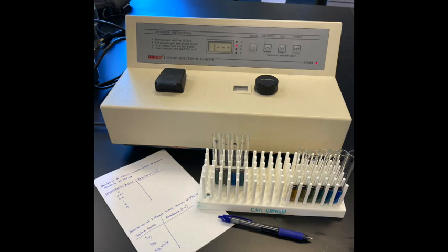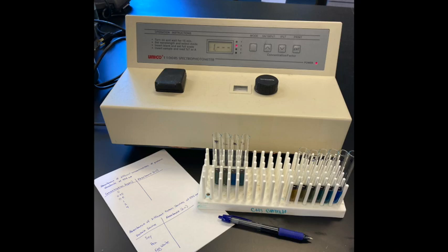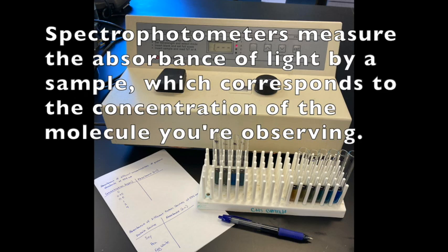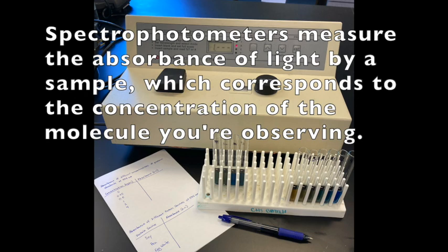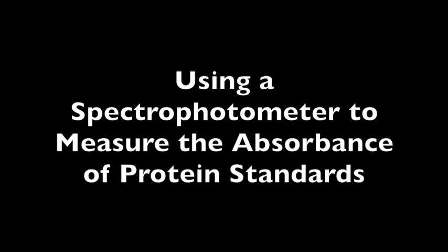This piece of equipment is called a spectrophotometer. It measures the absorbance of light by a sample, and the more light is absorbed by a sample, the higher the concentration of the molecules that you are looking at. So a higher absorbance value means a higher concentration of your molecule of interest. Now we're going to collect data by using the spectrophotometer to measure the absorbance of the protein standards.